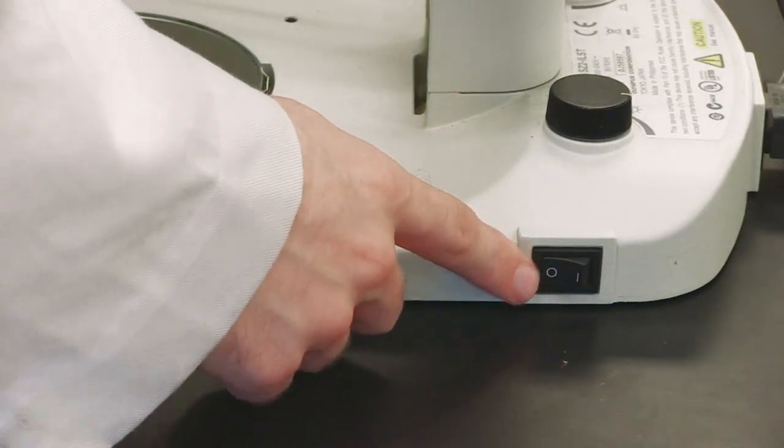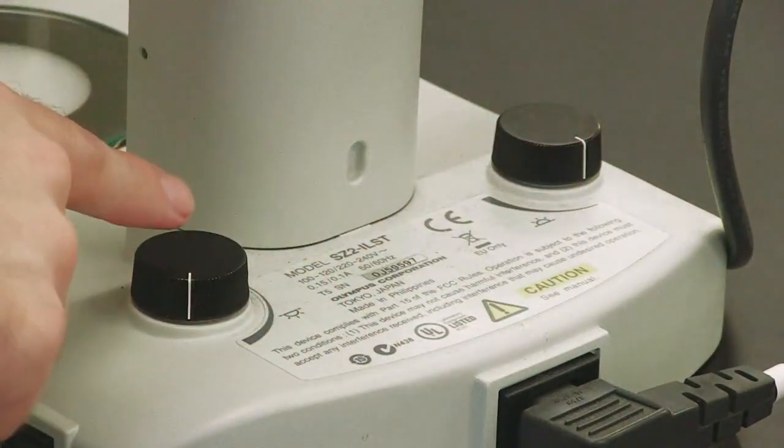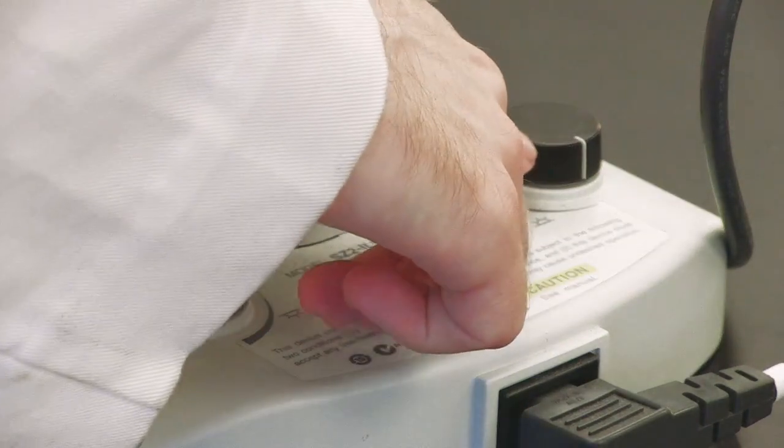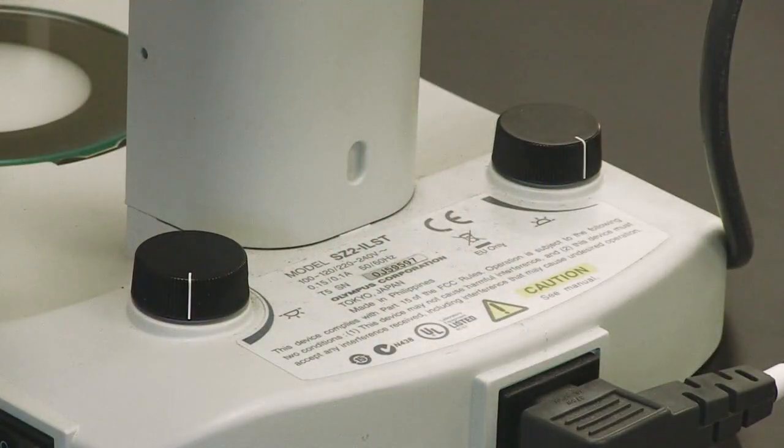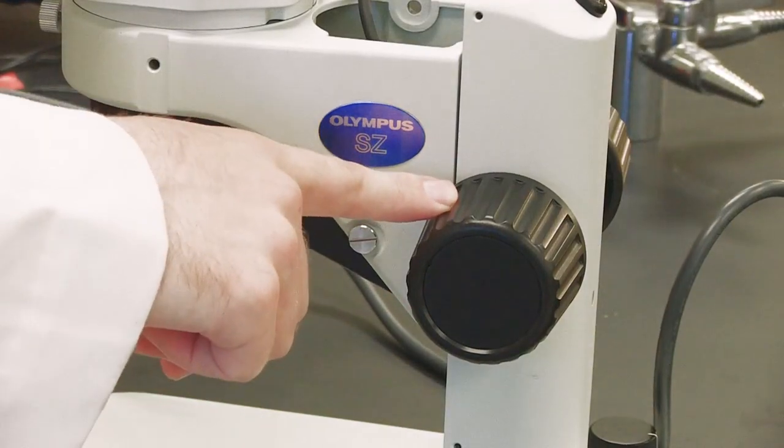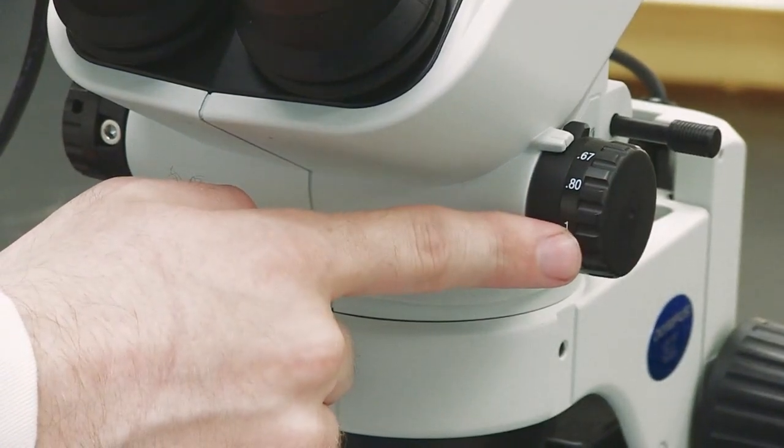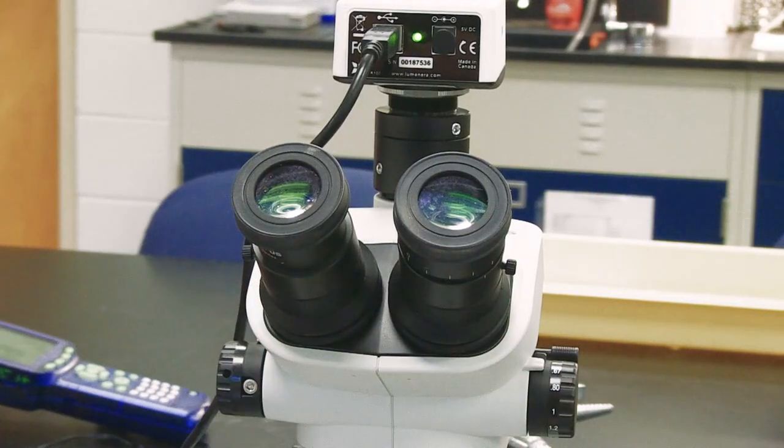The on/off switch, the light adjustment knobs, this light is the stage adjustment, the stage head light adjustment, the focus knob, the zoom, and the ocular eyepieces.